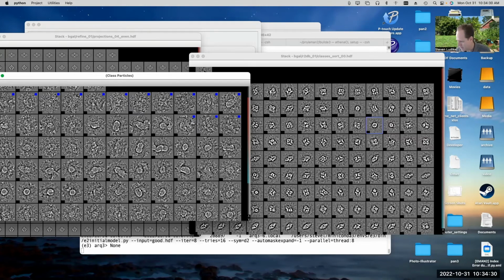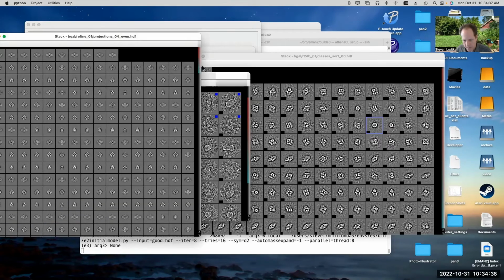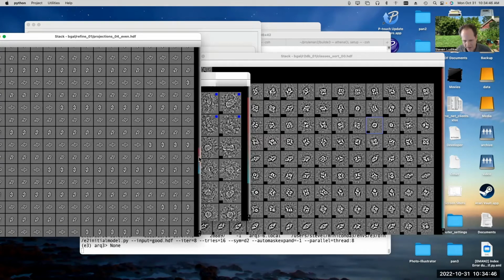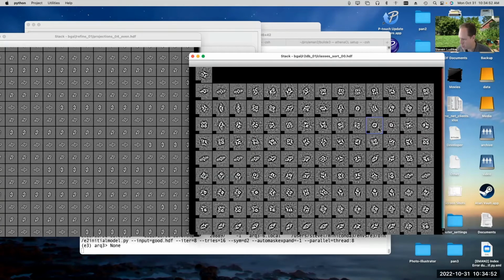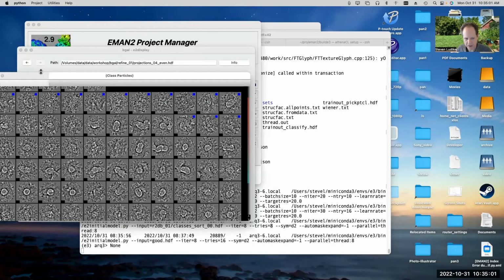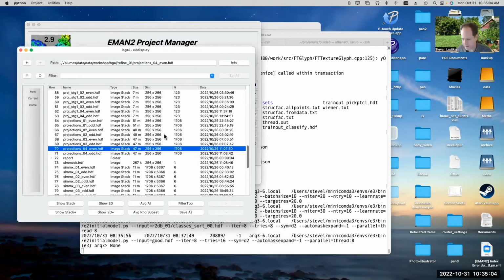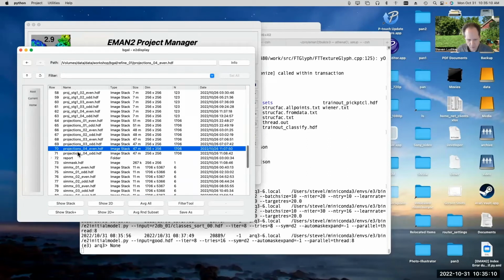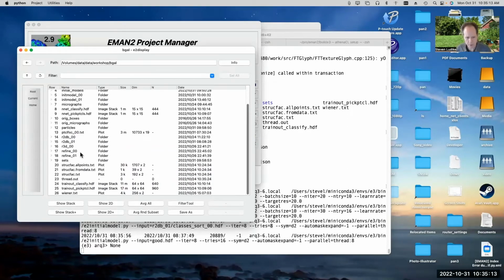Now, if you get some of the intermediate tilts, orientations like this with this bright lobe here, if you get enough of those in there, that can sometimes fix the problem. But anyway, for beta galactosidase, you have this pervasive issue, which is that one of the views of the particle has a tendency to look a lot like ice contamination. Now, if you have a good data set that doesn't have any ice contamination, that can help. And I'll also point out, oh, actually, I didn't show it to you, the second strategy for looking at bad particles.